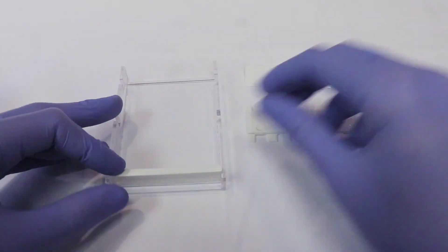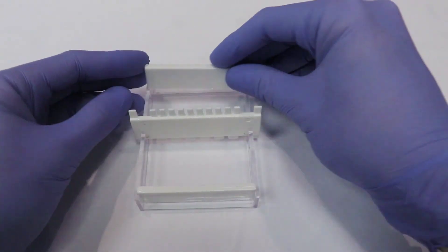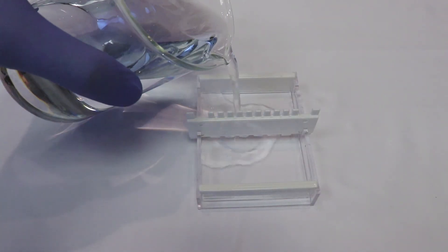Before beginning the experiment, you'll need to prep the gel and trays ahead of time. For this demonstration, we're using a melt and pour solution as opposed to mixing our own from agarose powder and buffer.